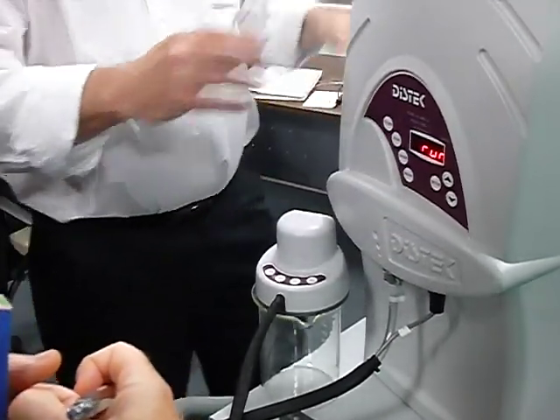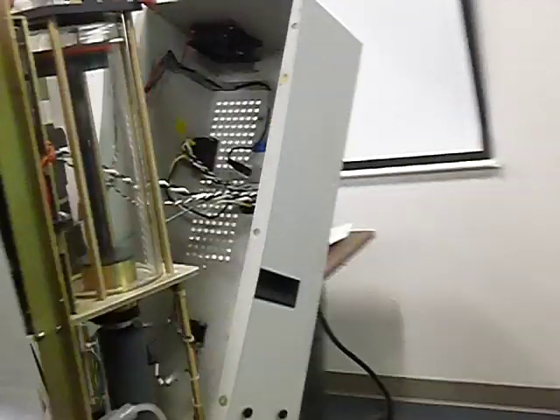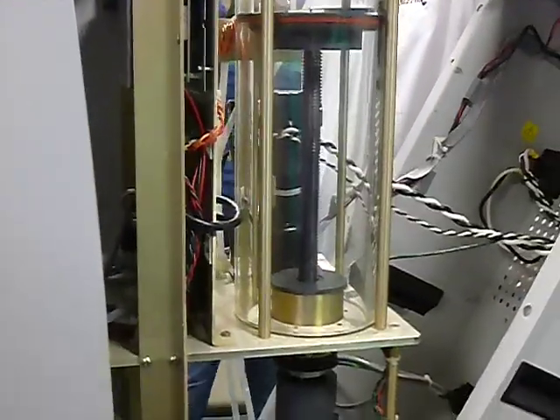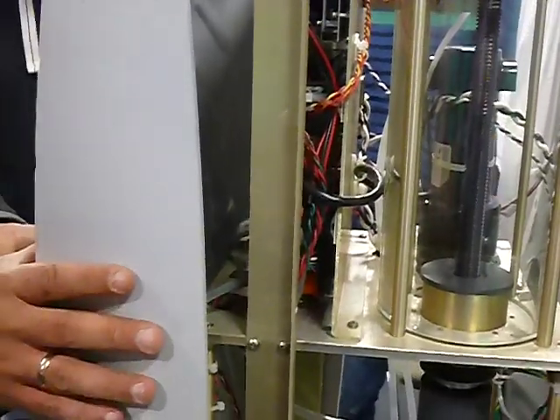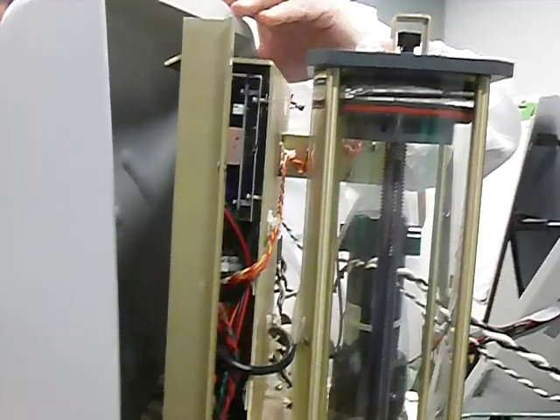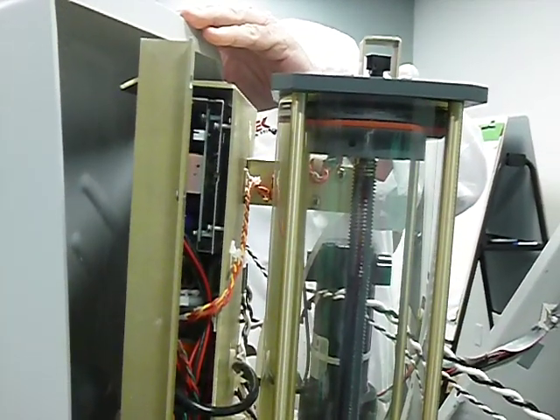All right, this is the piston, and this O-ring is creating a vacuum, right? Yeah, and during the run you can check the pressure from here. The up arrow, set up and up. Yeah, set up and up.